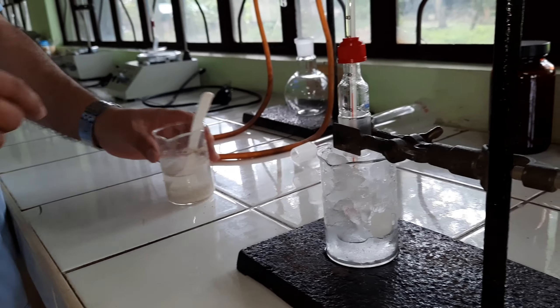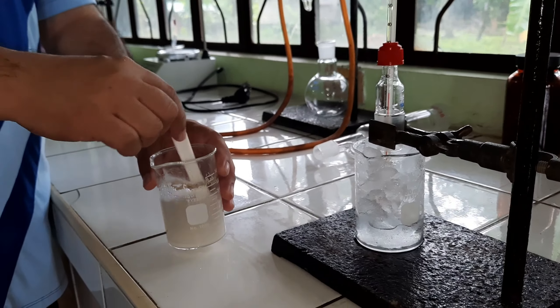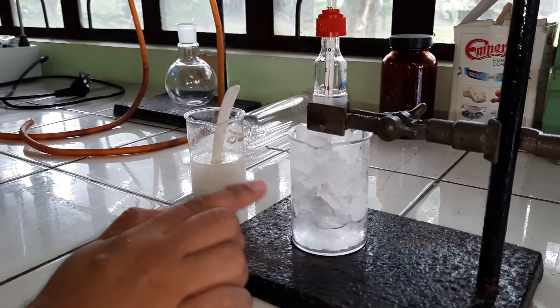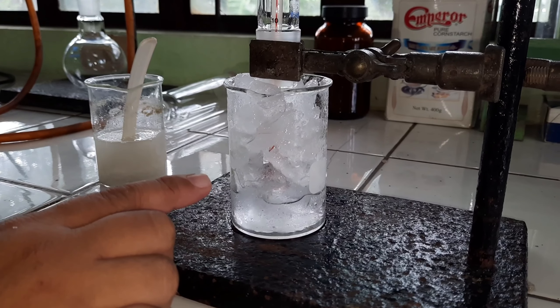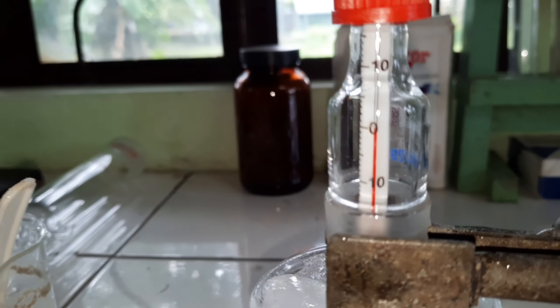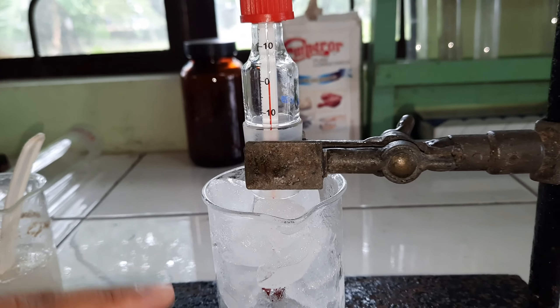Good morning class. To continue with experiment 9, let's take a look at how sodium chloride as a solute particle would affect the freezing point of water. We have here water freezing in the form of ice at 0 degrees Celsius. Focus on the reading.